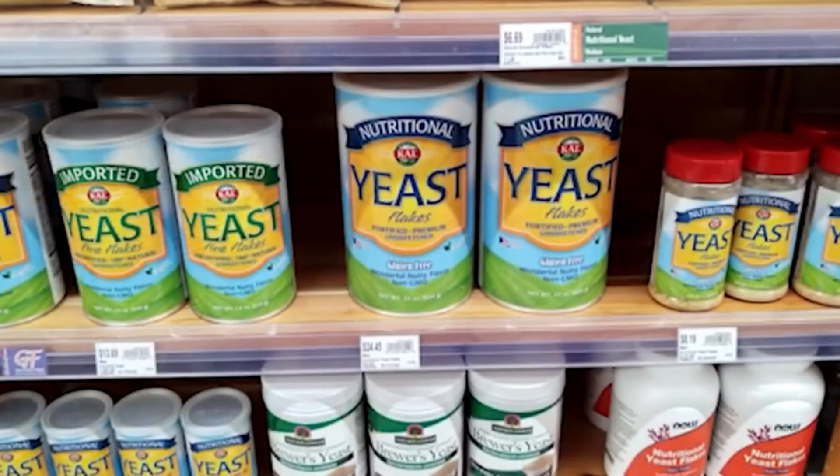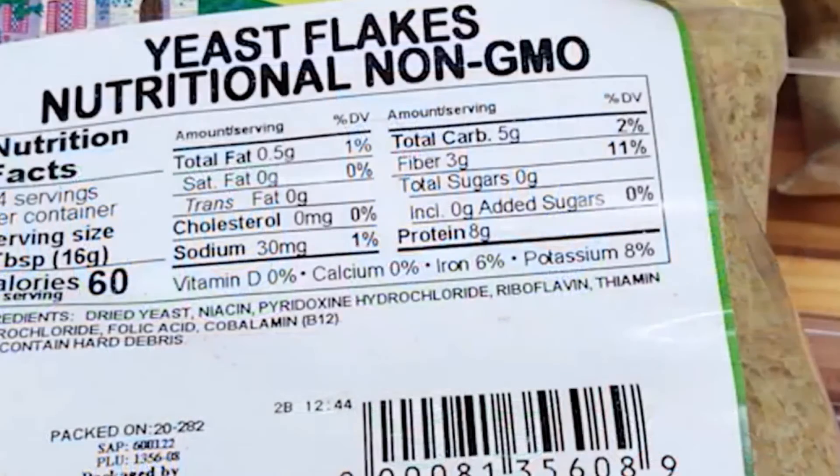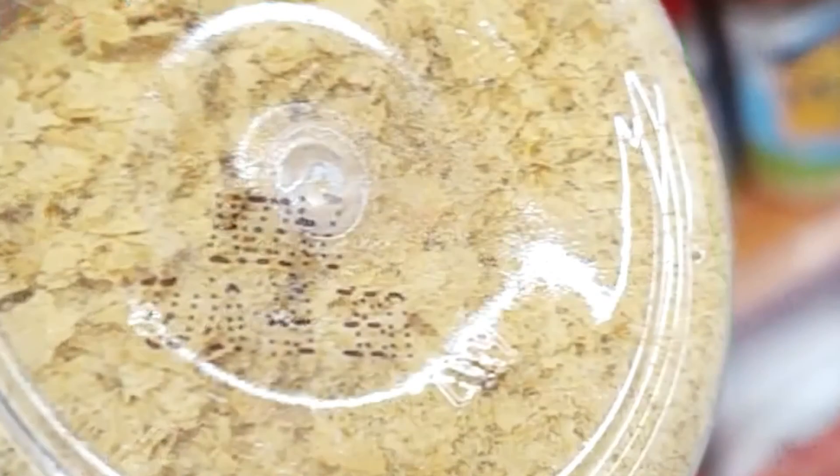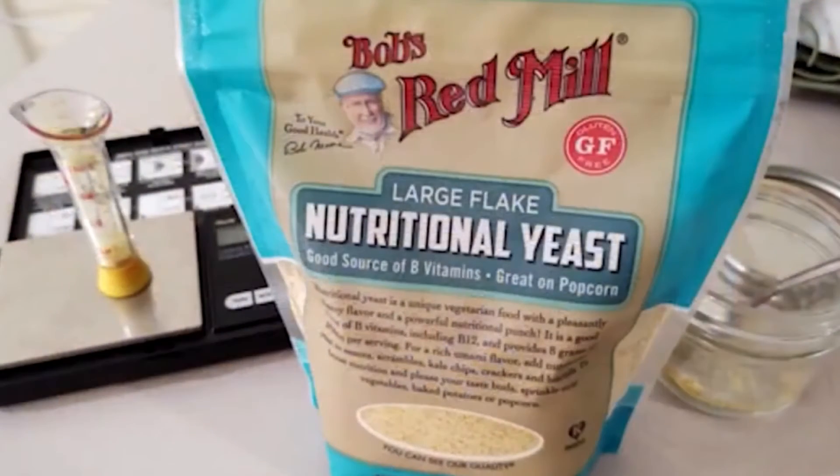Nutritional yeast can be found in most health stores or online and comes in various forms from powdered to large flake. Both of these are good, but you do want to make sure you grind it to as fine of a powder as you can.